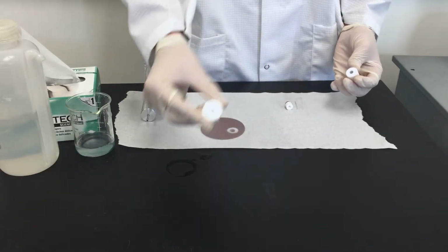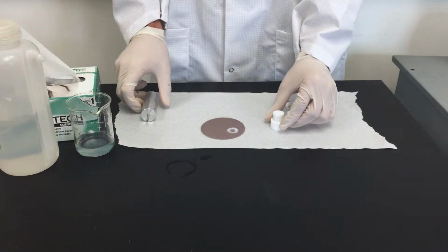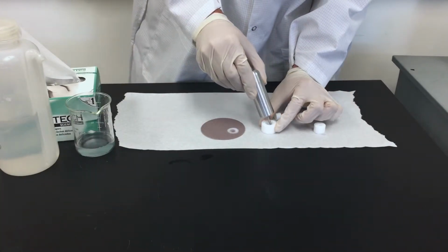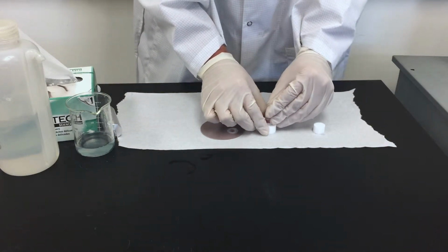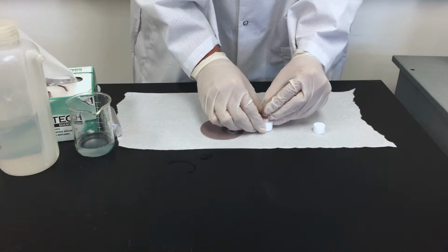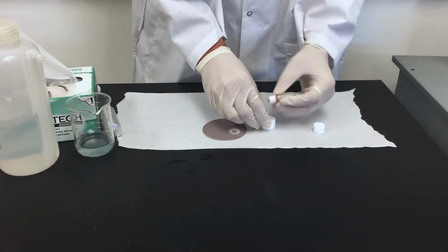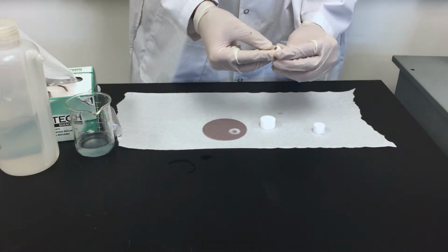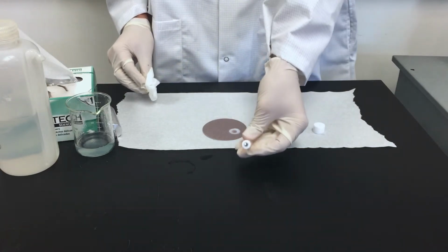Once the surface is clean, carefully remove the sample from the holder and place it into the second PTFE cylinder of the sample RDE kit. As needed, use the metal rod to position the steel sample to the center of the PTFE cylinder with the polished face down. Next, firmly press the RDE tip onto the steel sample. After the steel sample is wedged into the RDE tip, finish positioning the steel sample with your finger until the steel is flush with the PTFE on the RDE tip.